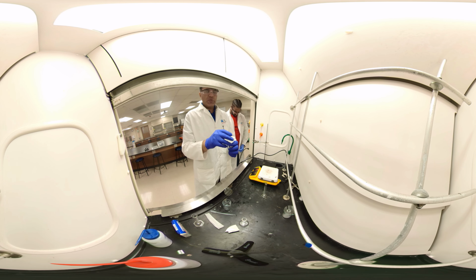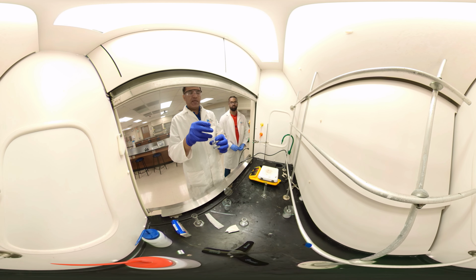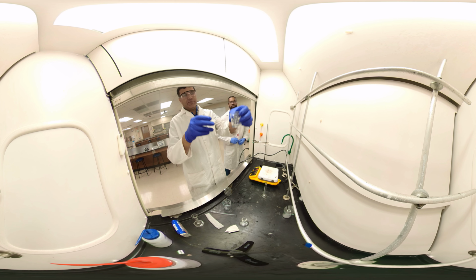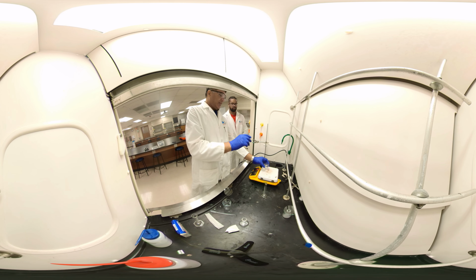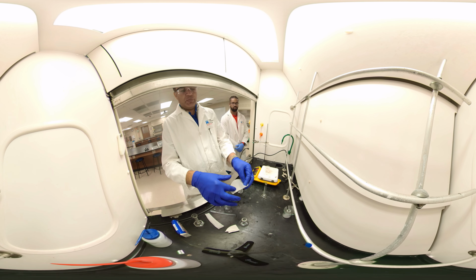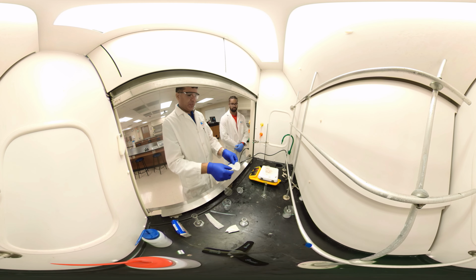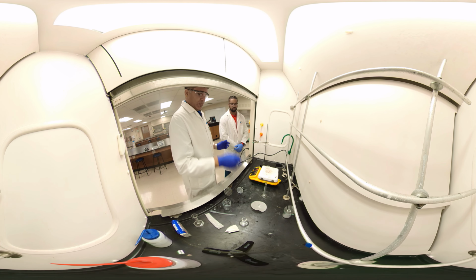Initially we separated two components from one another. What we had here was acetaminophen and binder. Now acetaminophen is dissolved in ethanol. It's here. And the binder remains on the filter paper. You can see some solid. We'll dry it in the oven for a while. We wash it, and that's our binder. We weigh it out. That is a good amount of solid. Okay, we can dry it in our oven.